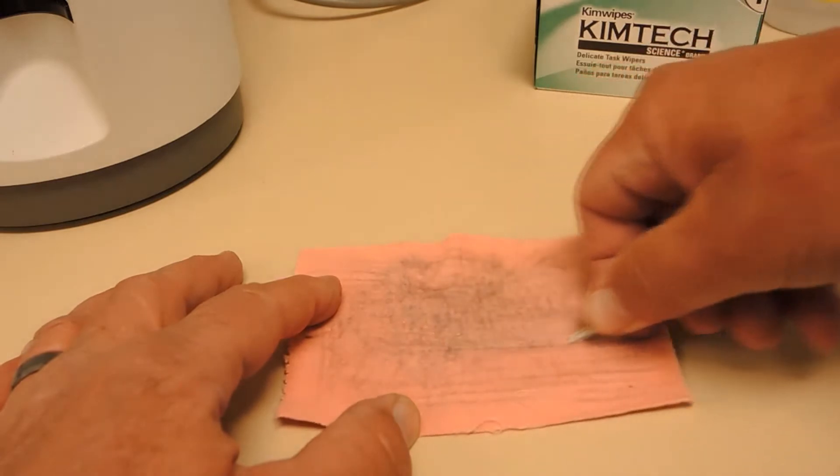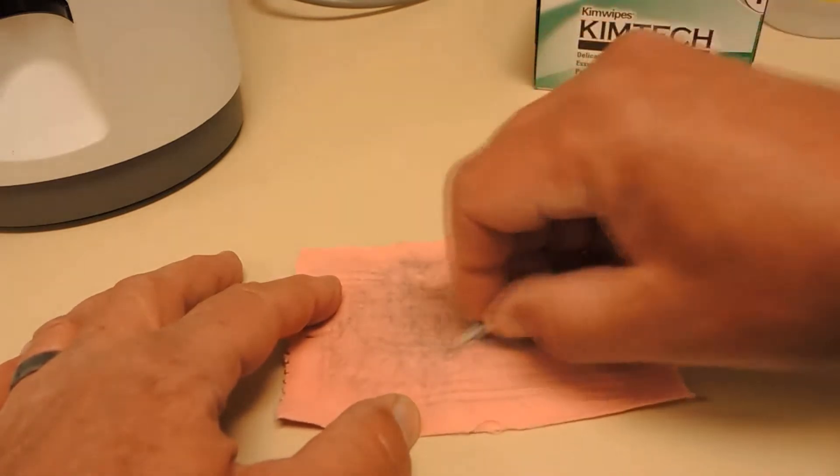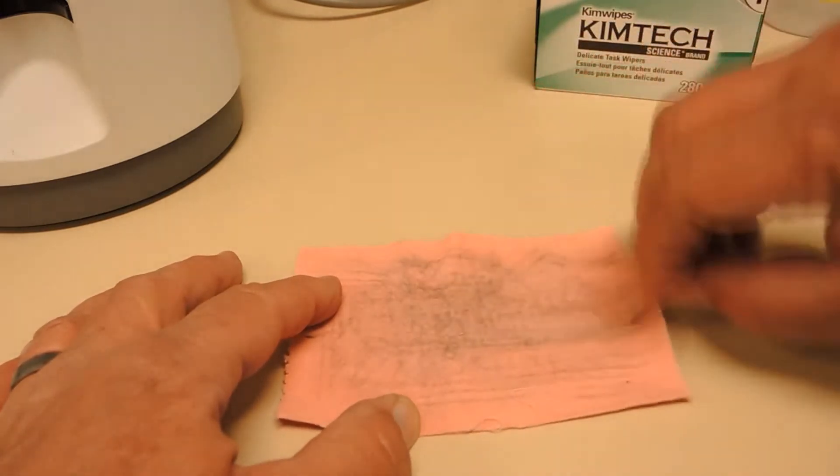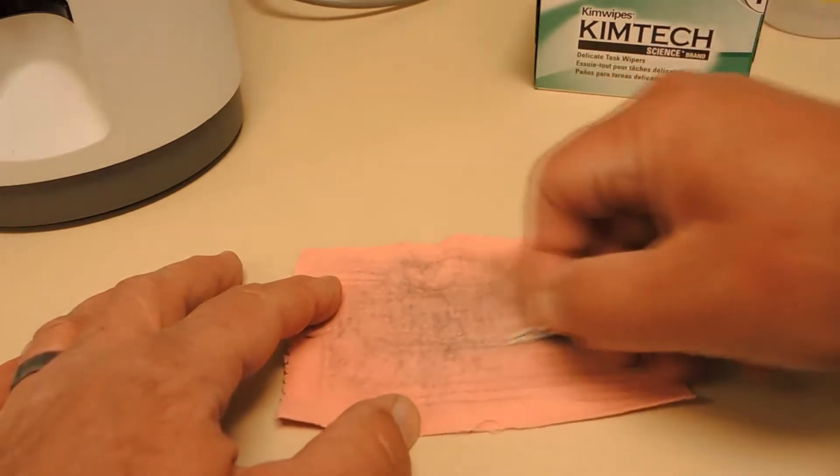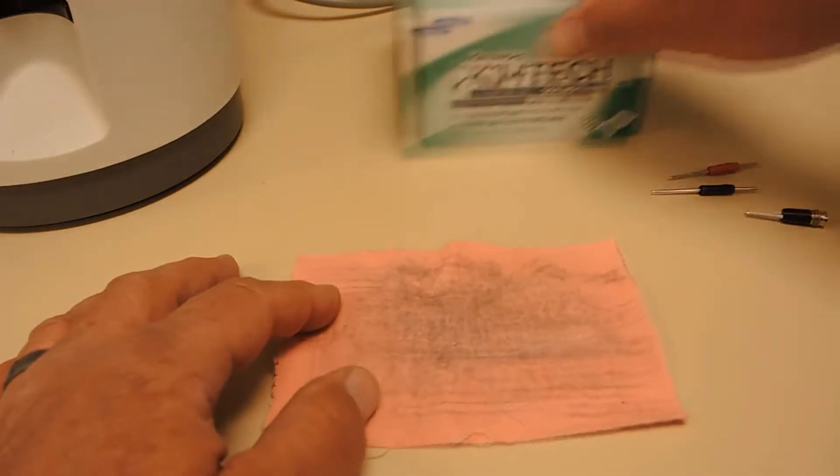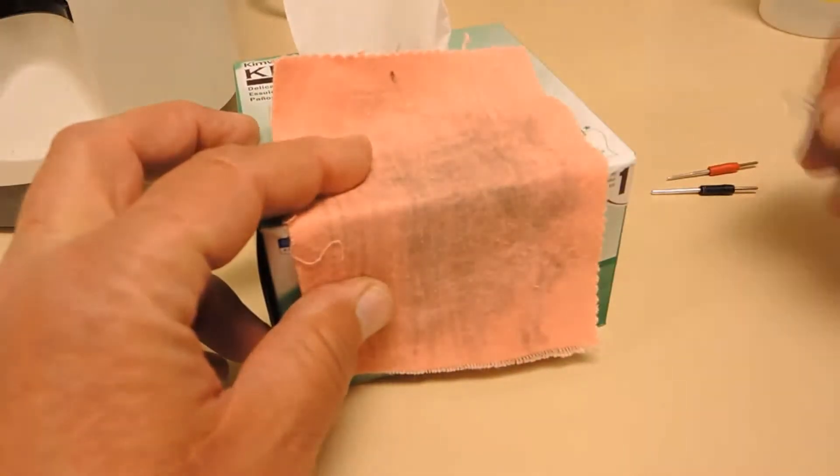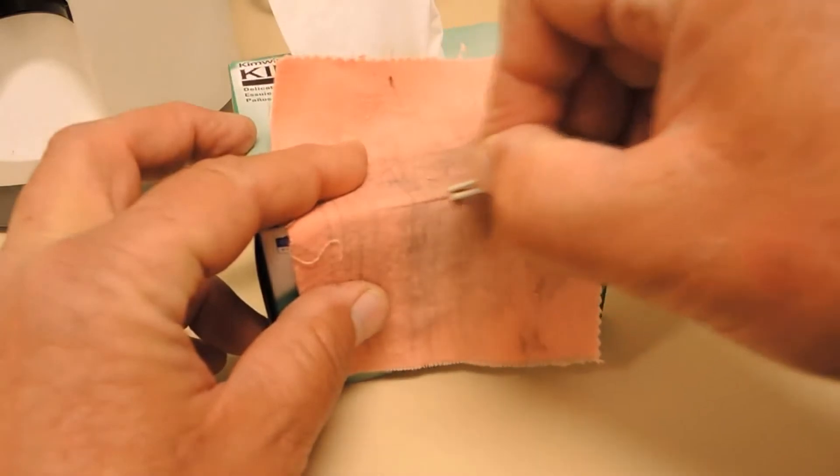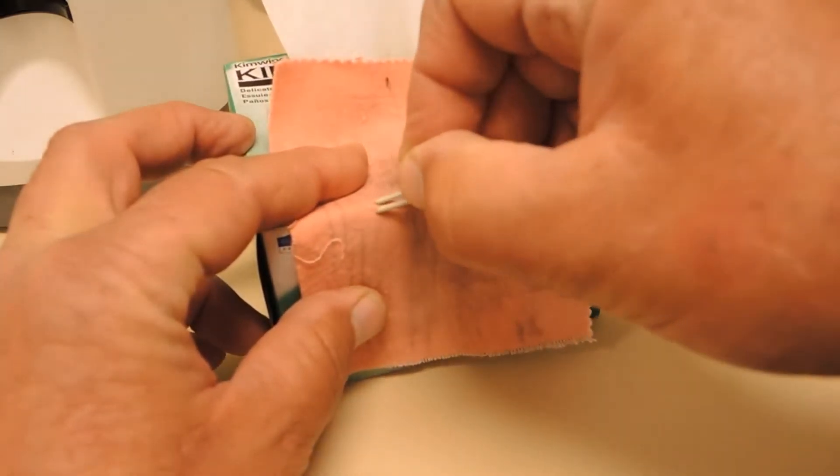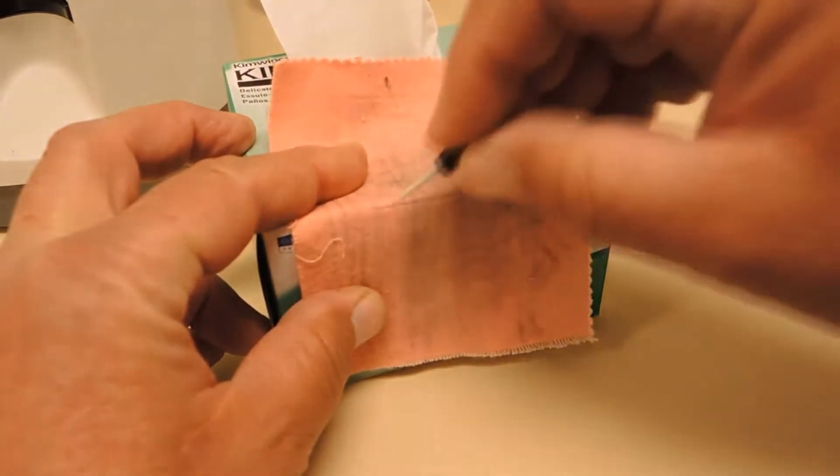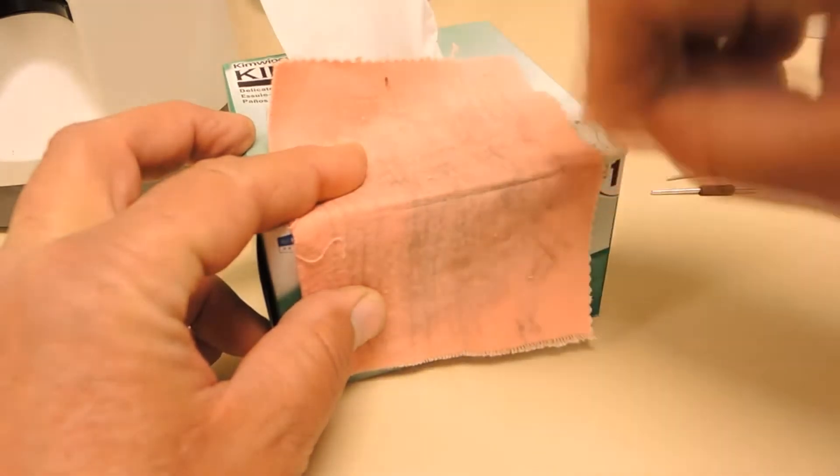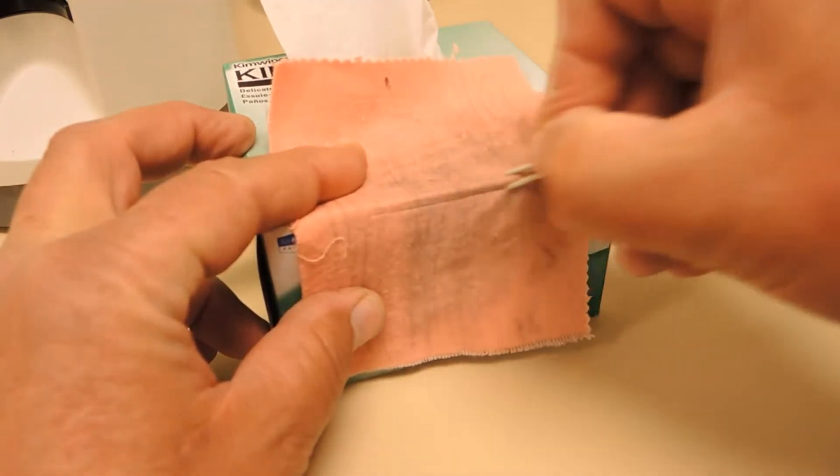So that you get the entire exterior surface and the tips cleaned off. Then over the edge of a counter or box you want to clean the tips across the corner so that it actually cleans between the two electrodes.